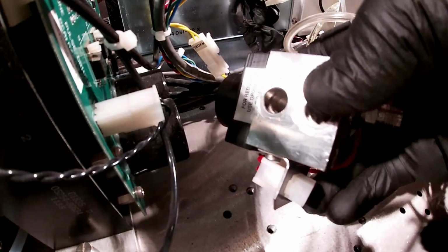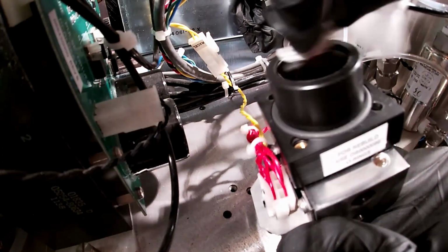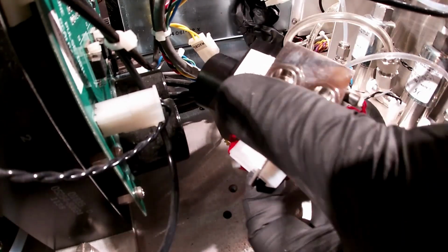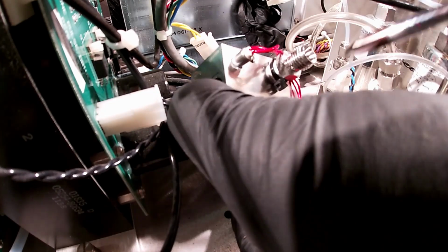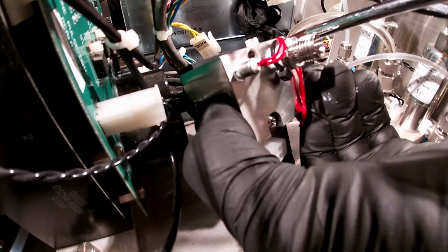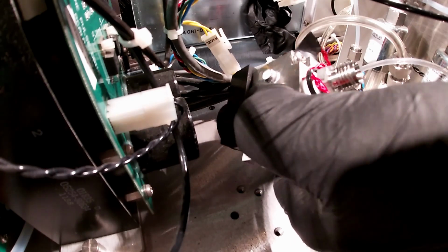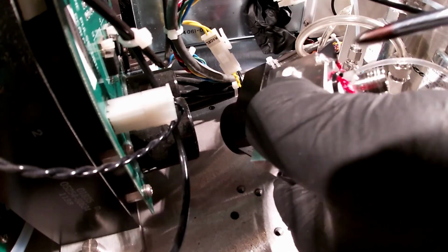Alright, so you can see we've got our chamber back on there with this words facing up, so we know what part numbers we need in the future. We've put our two shorter screws back in, got them both started so that they're in the recessed corners of the block here, and we're gonna go ahead and snug these up. So remember, this is an O-ring fit or O-ring seal, so we want to not tighten these really any more than hand snug. It's not necessary to tighten them very much.